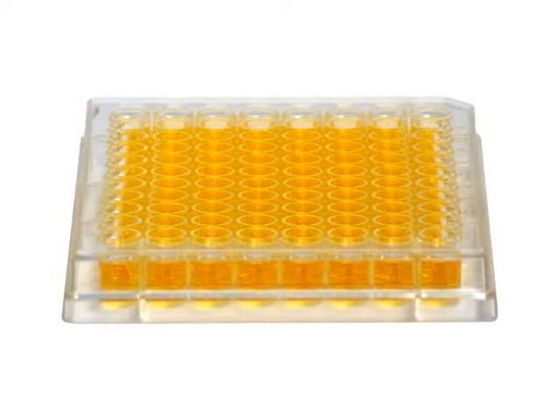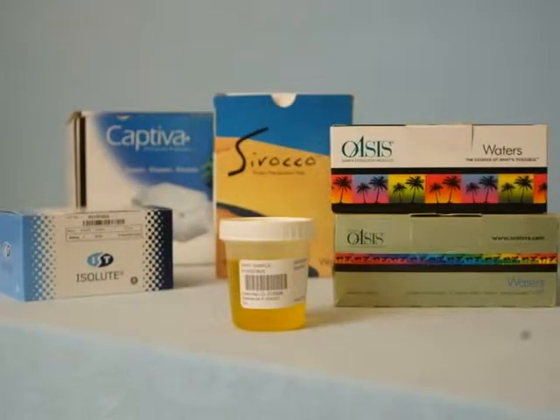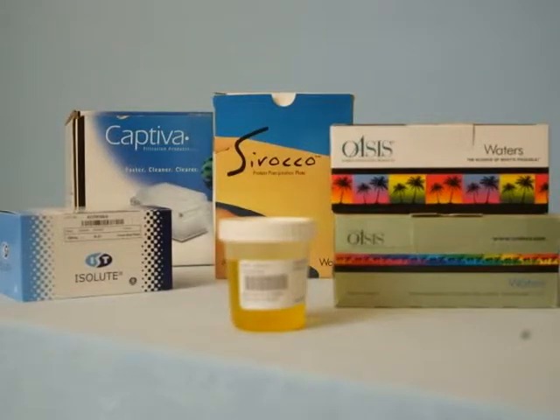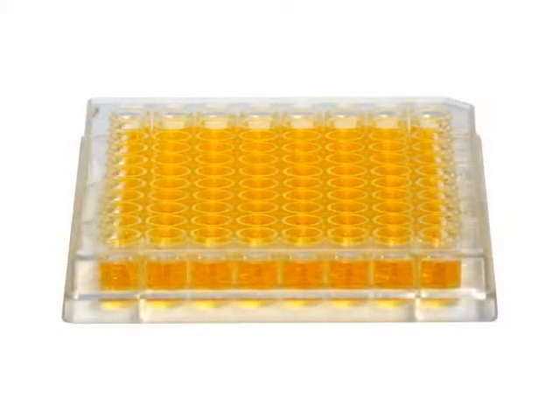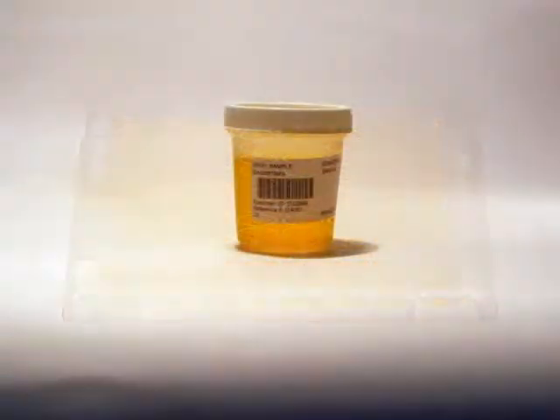The sample preparation for mass spec analysis is commonly accomplished in the 96-well format using protein crash, liquid-liquid extraction, or solid phase extraction. ELISA protocols are also run in the 96-well format. How to aliquot a measured volume from the source container to the 96-well plate for processing. A basic problem is the variety of incoming sample containers.